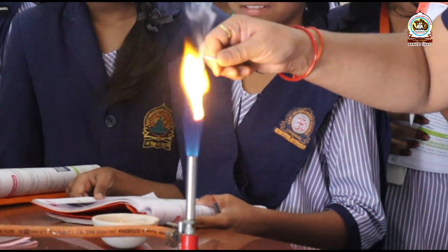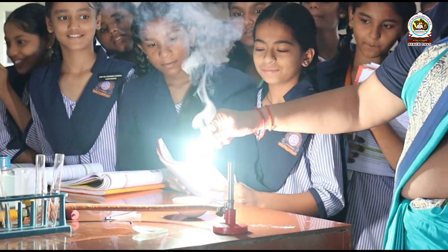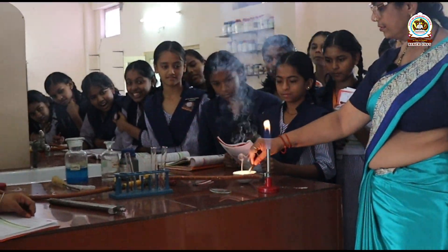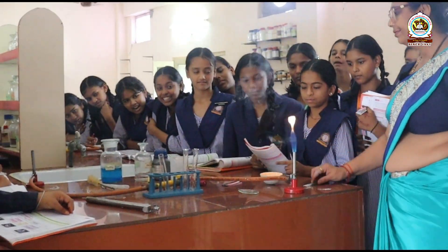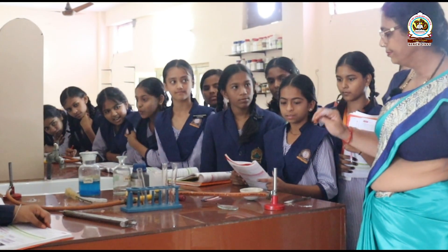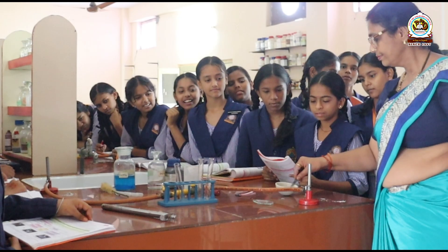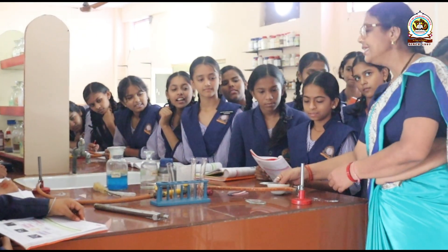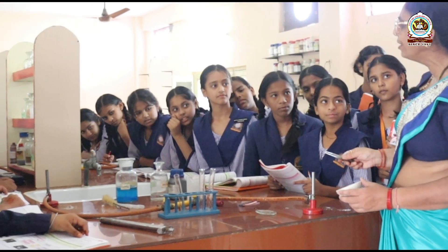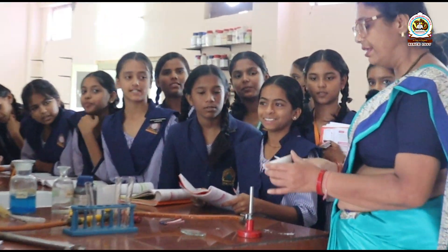We are seeing the white light is coming. We will stop the burner. We have to collect the ashes of that magnesium ribbon — these are the ashes of the magnesium ribbon.